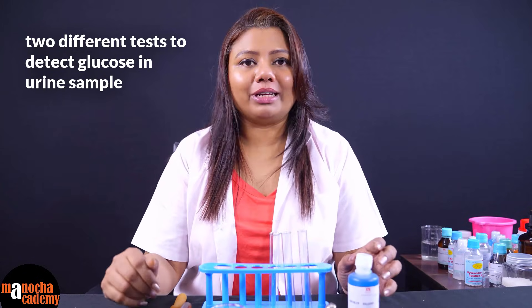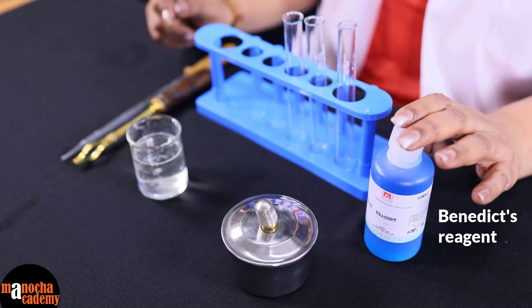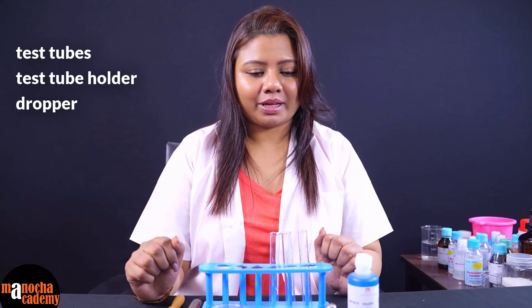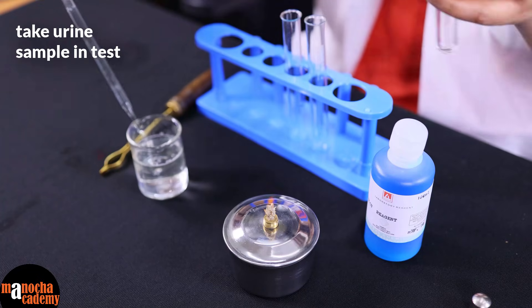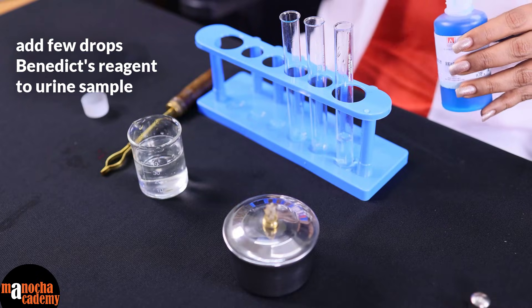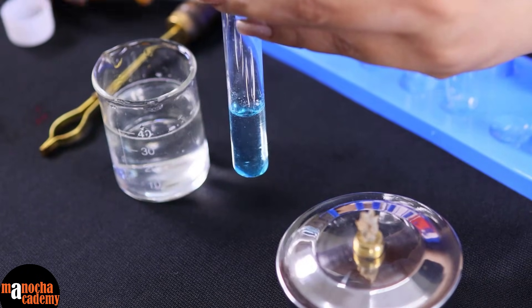The next experiment is to test the presence of glucose in urine. Glucose is present in the urine of a person suffering from diabetes mellitus, that is high blood sugar. We will perform two tests: Benedict's test and Fehling's test. For Benedict's test we need Benedict's reagent, a spirit lamp, the simulated urine sample, test tubes, a test tube holder and a dropper. I will take some simulated urine sample in my test tube and add four to five drops of Benedict's reagent. As you can see, it is now blue in color — it has taken the color of the reagent.